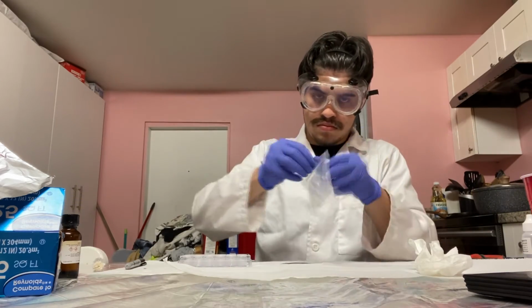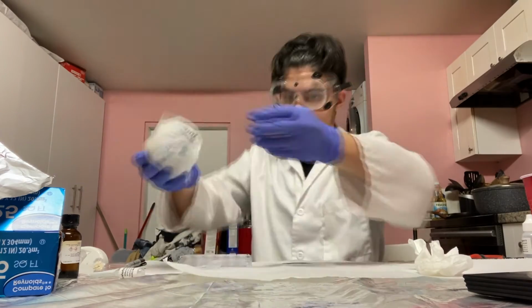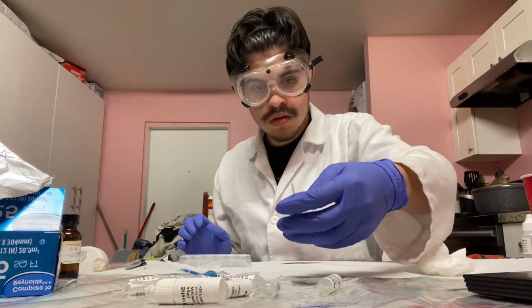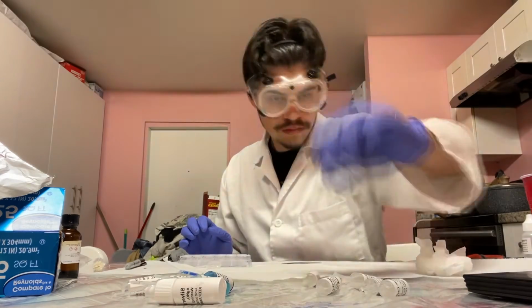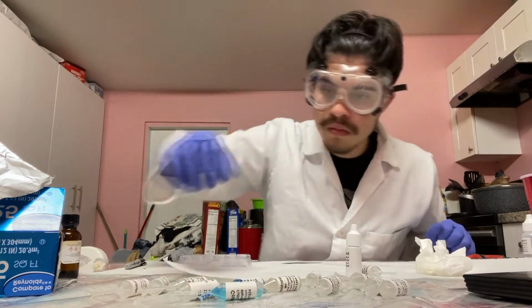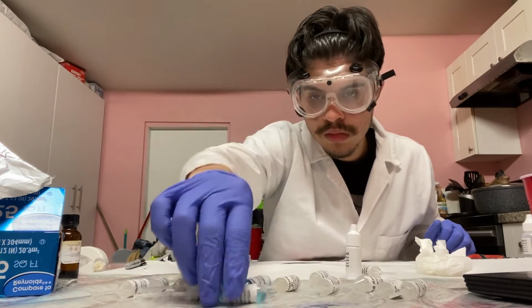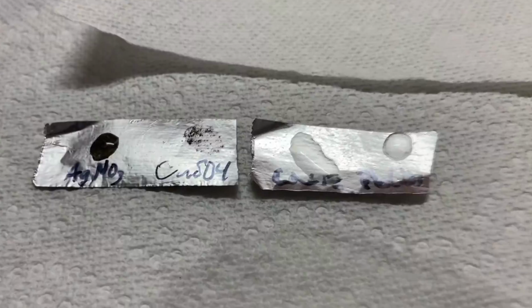Now that the initial and 5-minute reaction has been recorded, allow the reaction to continue for an additional 3 hours. Once the 3 hours are up, record your observations for the chemical reaction. Rinse the aluminum foil with tap water to remove any residue from the solution. Then, record your observations of the aluminum foil. This procedure will be repeated for the other 3 compounds. And that concludes part 1.